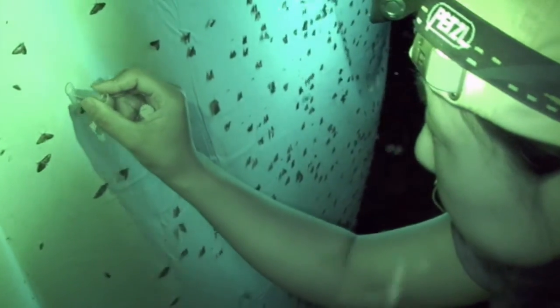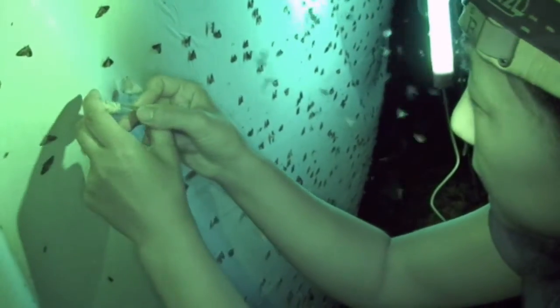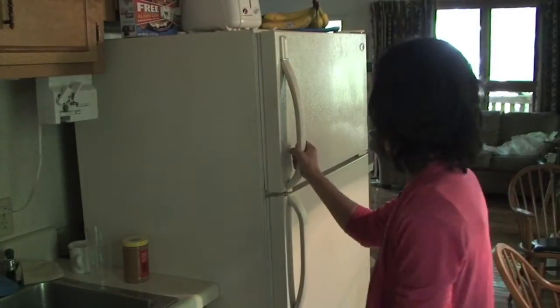Microlepidoptera can be collected individually in vials at a blacklight, and then the vials placed in a freezer for killing the specimens.